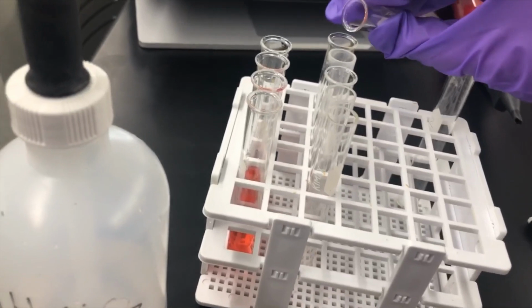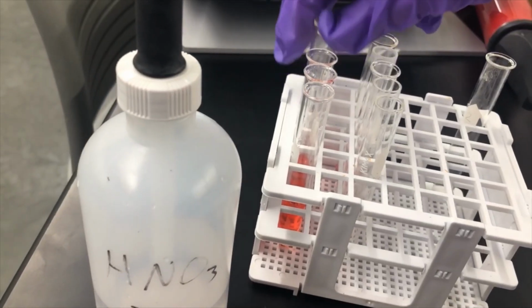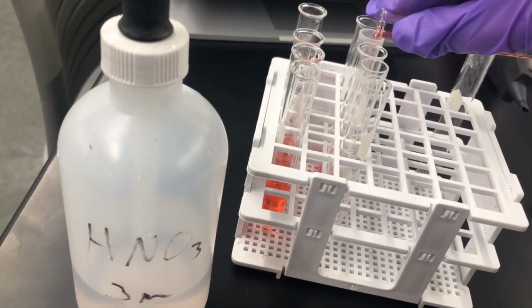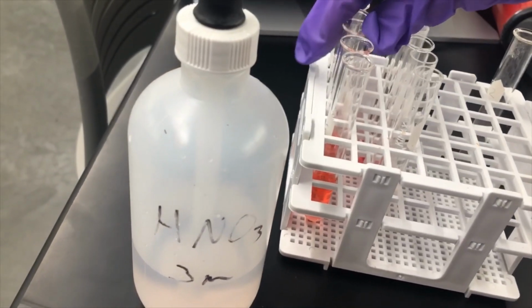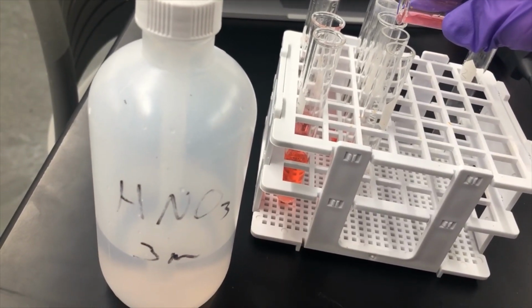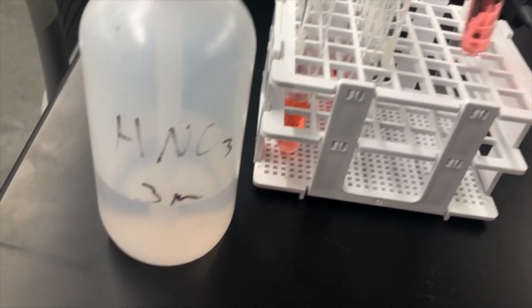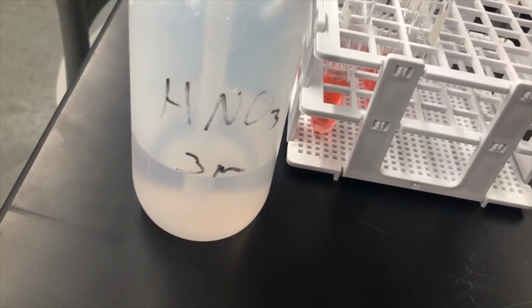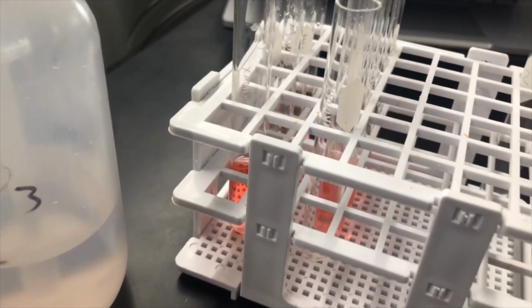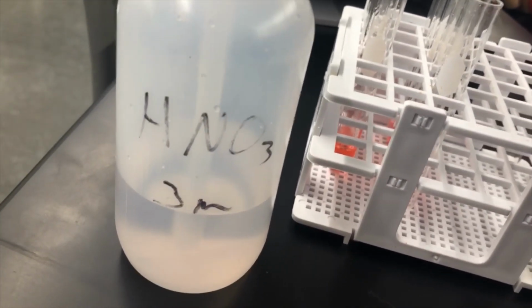So this is the barium carbonate. Here is barium chloride. Barium sulfate. Sodium carbonate. When I poured it, it mixed it up a little bit more and it started fizzing. So a lot of carbonate ion there. And then lastly, sodium chloride.